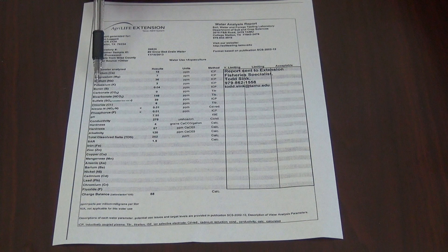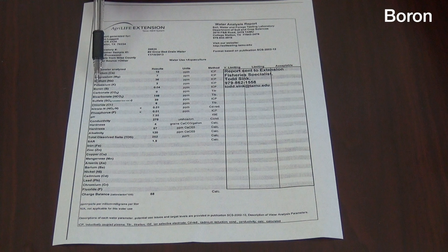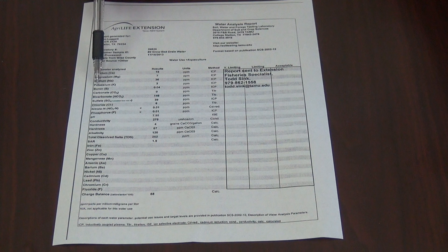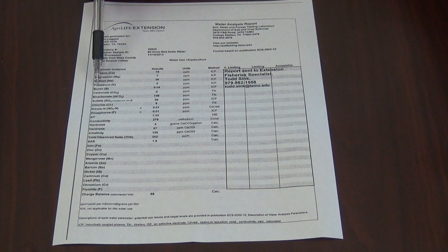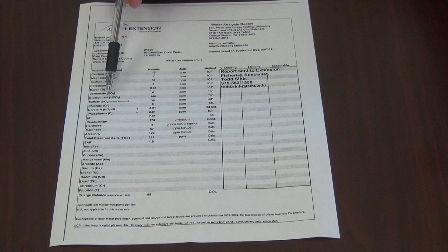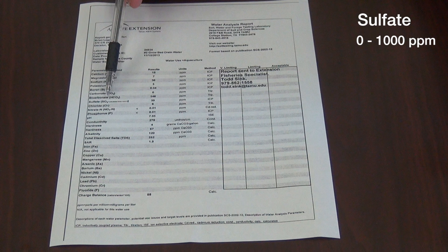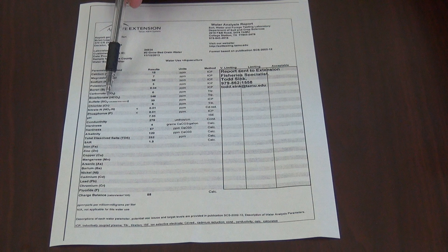Boron is often a topic of concern for pond owners because here in Texas, some of our groundwater has exceptionally high boron concentrations compared to other parts of the country. It is not uncommon to see boron concentrations in excess of 10 parts per million. While we do know boron can concentrate in water and in the soils of the pond bottom, there are no immediately known detrimental effects to your fish population or recommended concentration limits. Here we see the sulfate concentration in the water. Like boron, groundwater and well water in Texas can have higher than normal concentrations. Sulfate can range from 0 to 1,000 parts per million. It is generally not a concern for your fish population, but may be of concern if the water is being used for other purposes, such as watering livestock or irrigating crops.